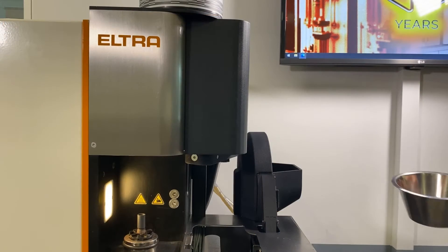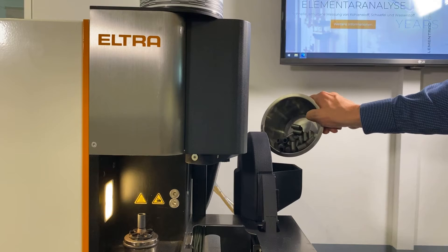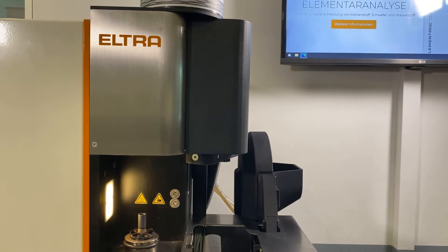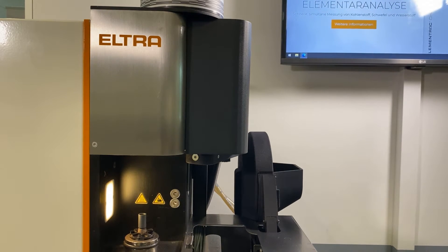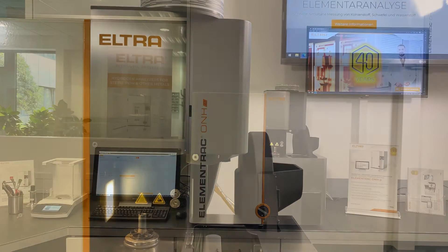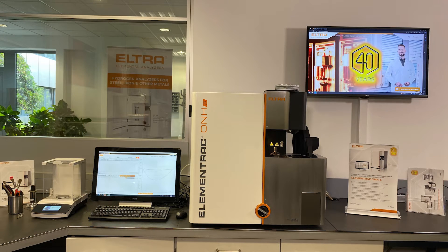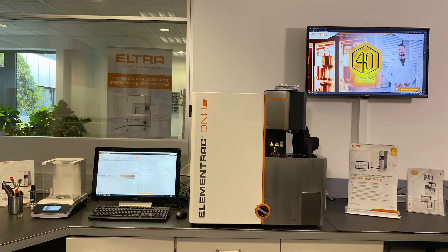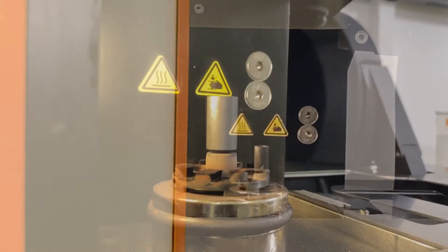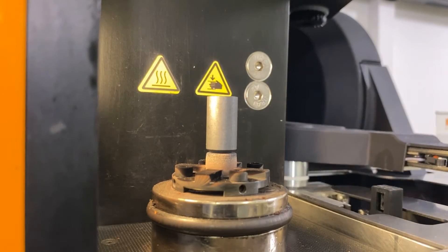The graphite crucibles can simply be poured into the receiving hopper of the auto loader — they do not have to be aligned in a time-consuming manner. The auto loader supports you in your efficient laboratory operation, and up to 32 analyses can be performed fully automatically and autonomously.